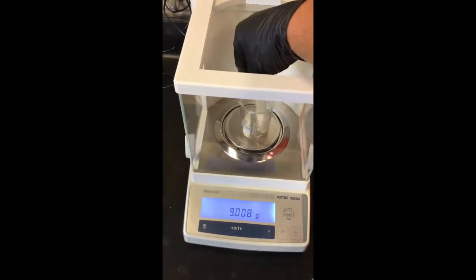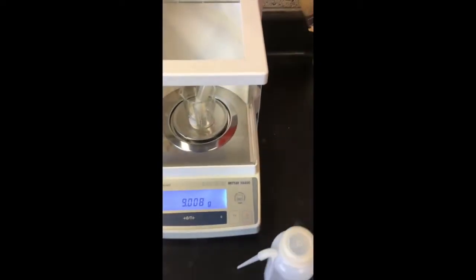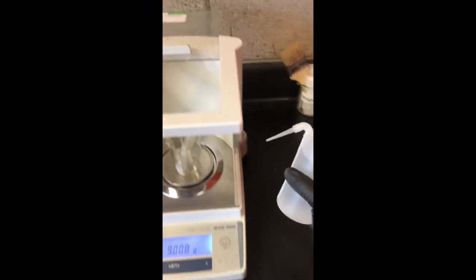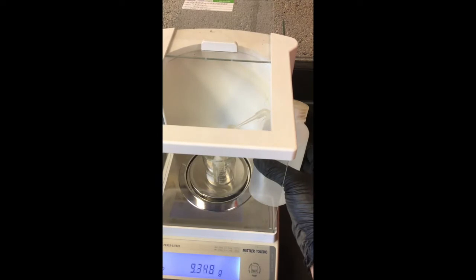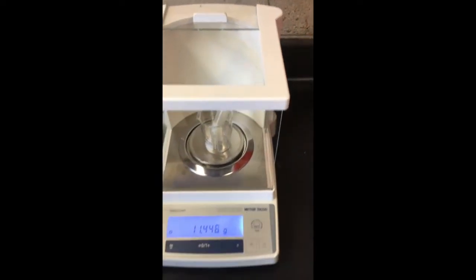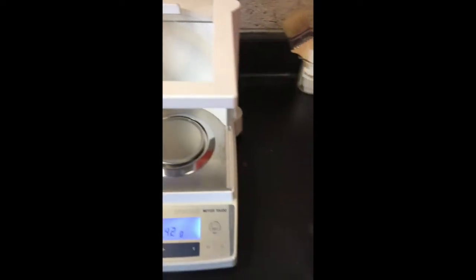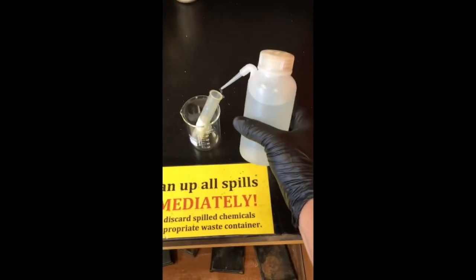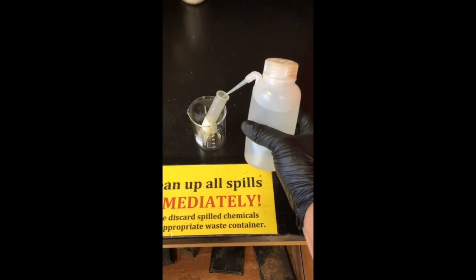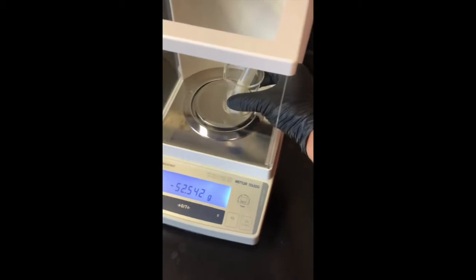We need about 15, right? So let's open this bad boy open. Use the squirt bottle, squirt a little water in there very carefully. You should probably take this out, so we don't squirt water onto the scale. And then we'll just go ahead and weigh that.